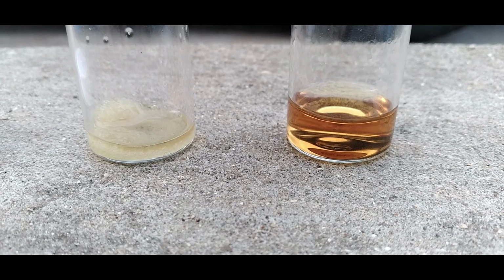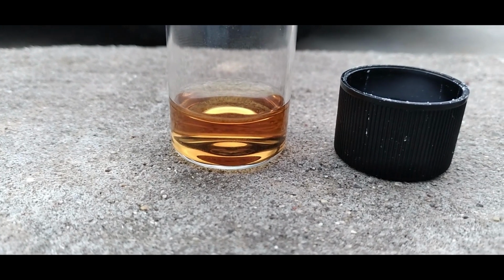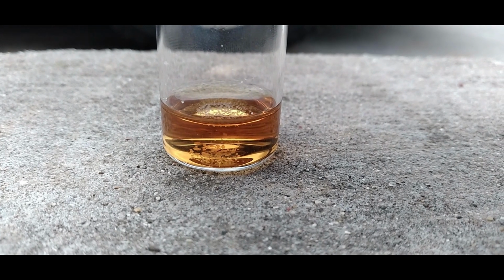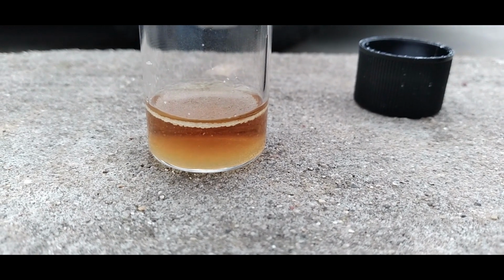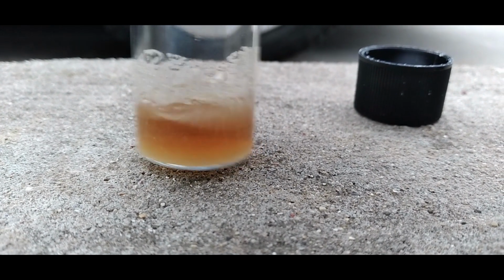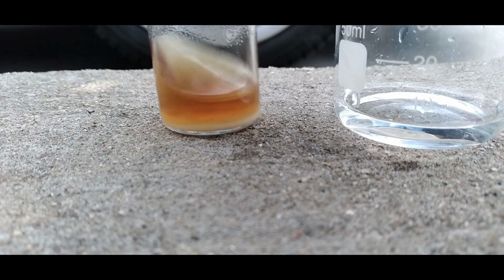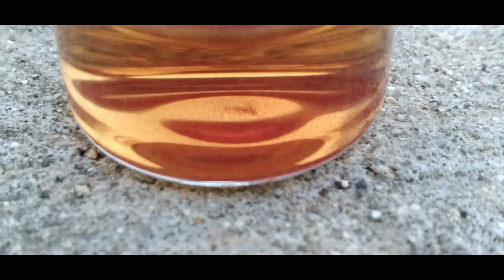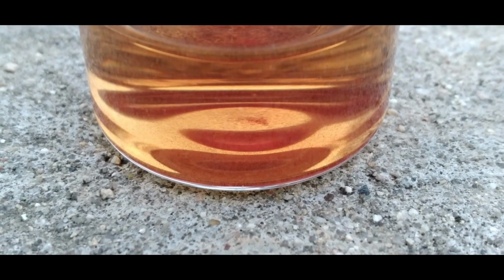After separating the sodium chloride precipitate from the rest of the solution, I made one last ditch attempt to obtain a hexachloroosmate salt. I decided to add ammonium chloride to the solution. If there's any sodium hexachloroosmate present, there will be a double decomposition reaction forming ammonium hexachloroosmate, which due to low solubility should crash out of solution. Because there wasn't enough solution to dissolve the ammonium chloride, I decided to dilute it with some water. Once all of the ammonium chloride had fully dissolved, a very small amount of a red precipitate began to form. This is ammonium hexachloroosmate.